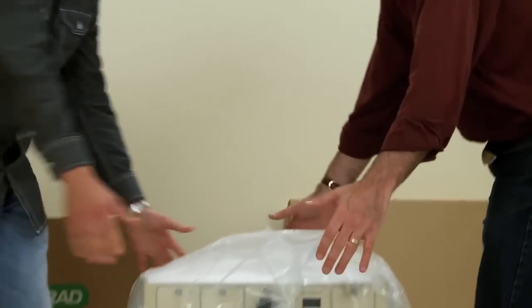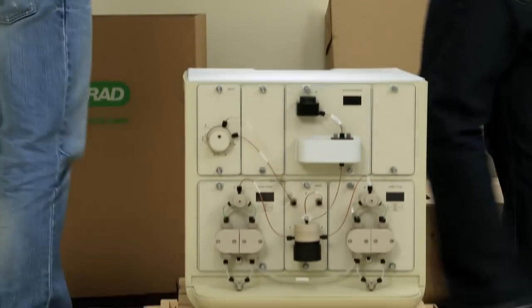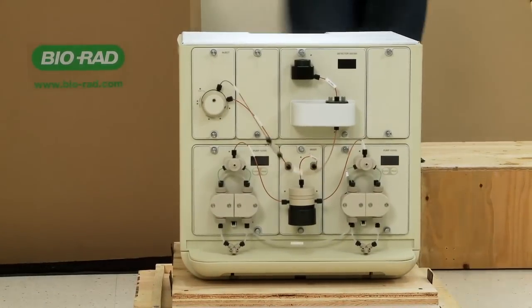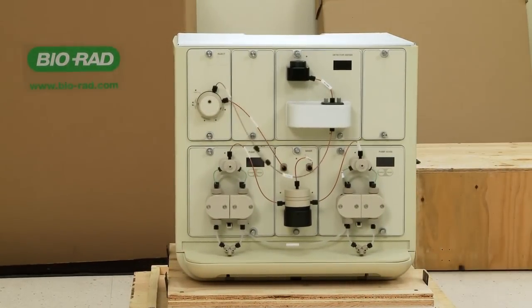Remove the plastic wrap and place the outer box aside. Your NGC is now ready to be placed on the lab bench you have prepared.